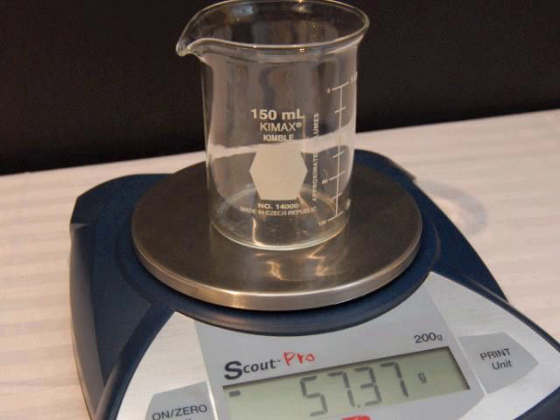Let's start by measuring the mass of the beaker. We'll be using the beaker to put our sand and salt mixture into. We could have zeroed this out, but just to help us understand how to subtract out a measurement, we'll just go ahead and write this down, 57.37 grams. Don't round it up to 57.4 grams. You lose accuracy if you do that. Use all the decimal places that are there and record that number, 57.37 grams.